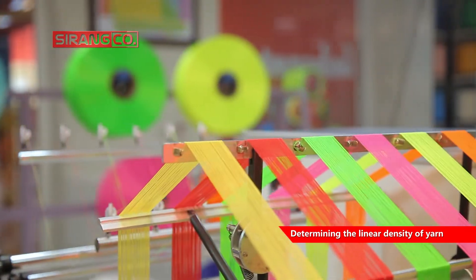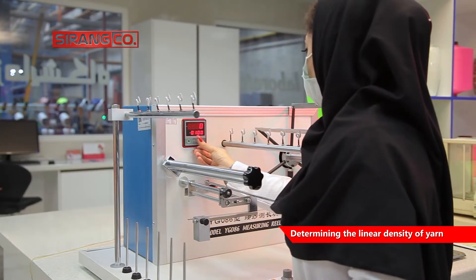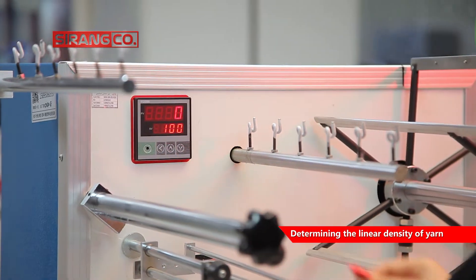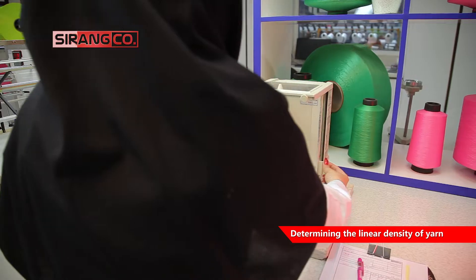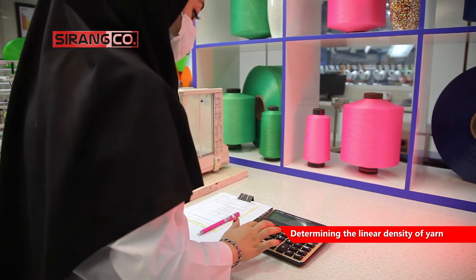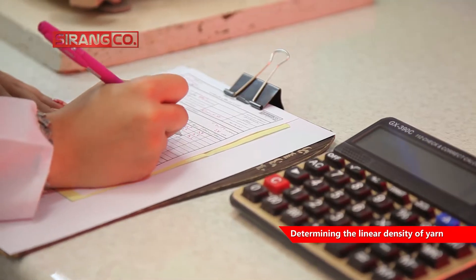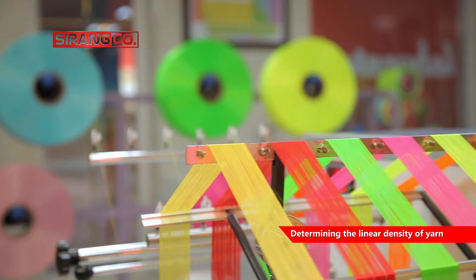The machine also has a mechanism that prevents the layers of yarn from becoming entangled. The number of turns of the wrap reel machine is adjustable, so the prepared skein with a certain length is weighed with a digital balance, and having the length and weight of the yarn and the existing relations, the linear density can be calculated.